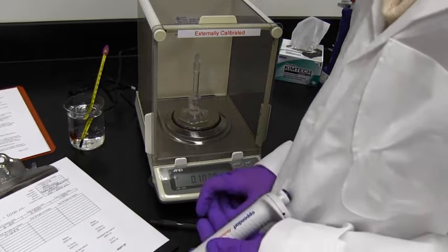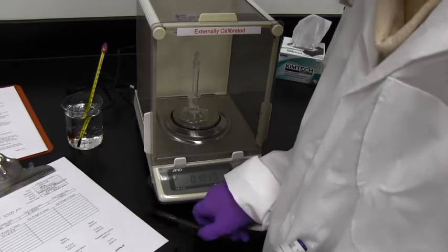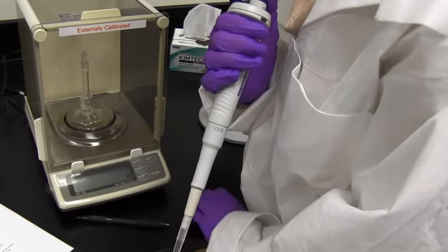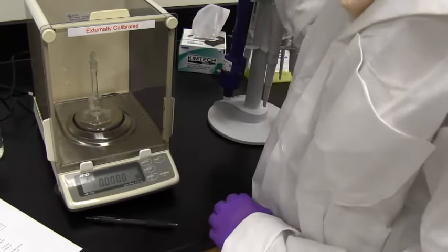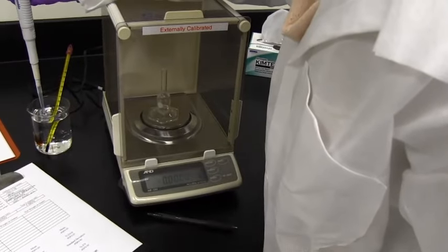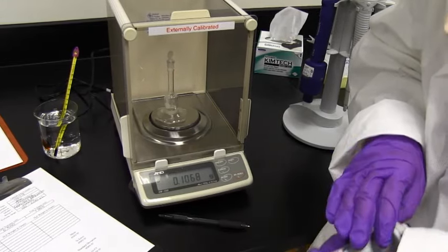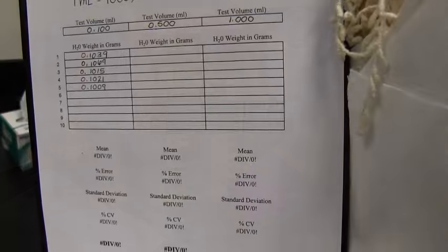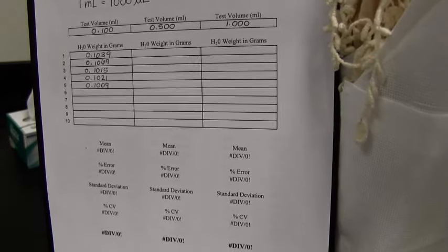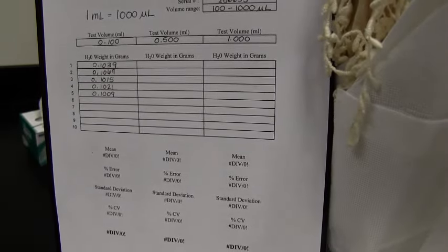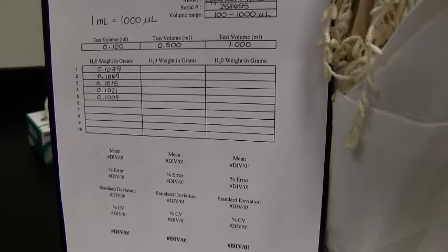And we will be repeating this process either 5 times or 10 times, depending on your SOP. After we've gotten our first value, we're going to re-zero or re-tare it. So we're back to 0 grams so we can record our next volume. So let's take another 100 microliters. And this time it's 0.1068. So I'll go ahead and record that value. For the 100 microliters sample, I've actually done it 5 times. I have 5 replicates here. And now we're going to move on to the 500 microliters or half a mil.